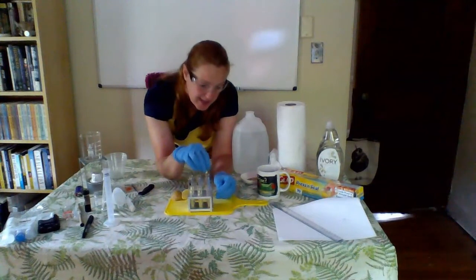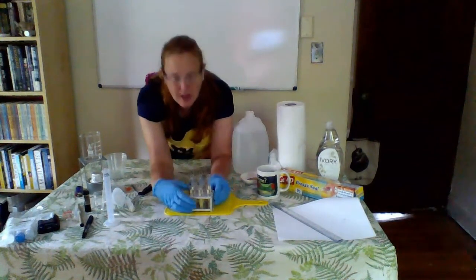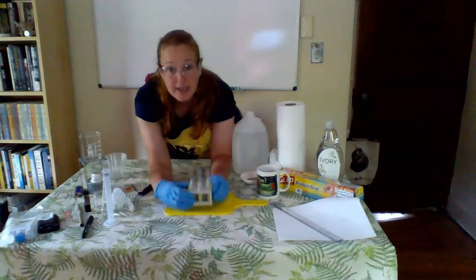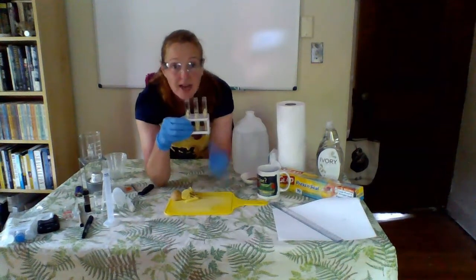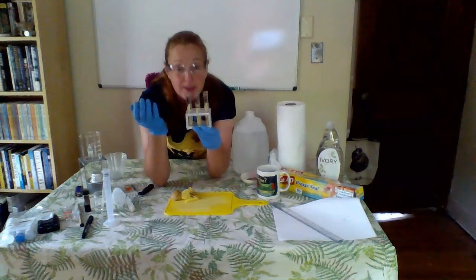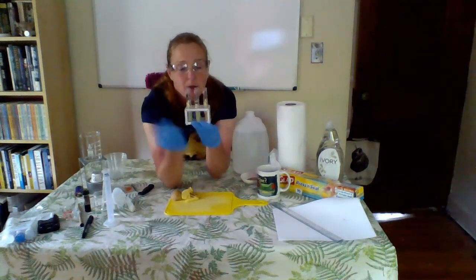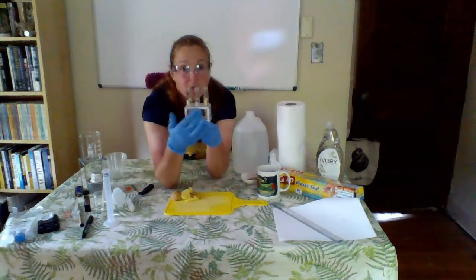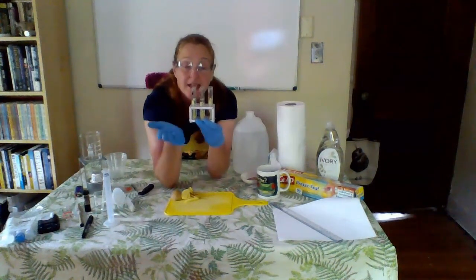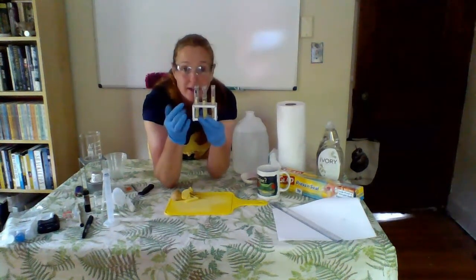So here's my last test tube that I need to add my little French fried potatoes to. And one of the things that I love about this type of experiment and any type of experiment is that we have a double check. We've got this visual double check to make sure that we did everything accurately. So when I look across these test tubes, what I can see is that the volume in every test tube is the same. Even after adding my potato chunks, all of my test tubes have the same amount of liquid.